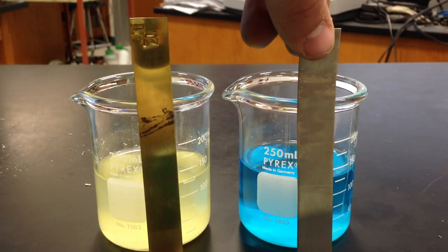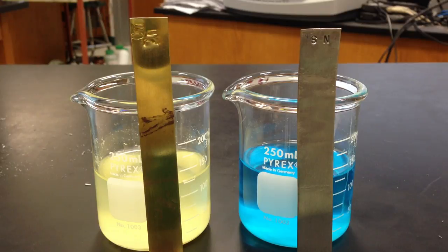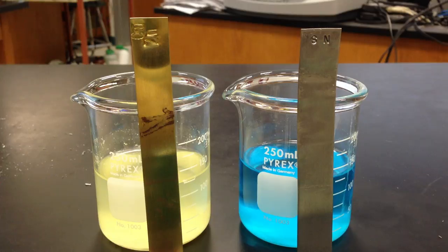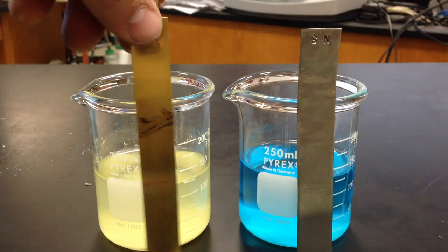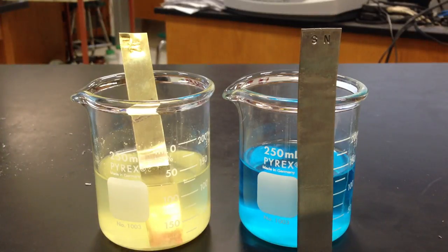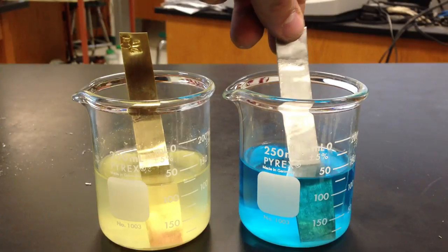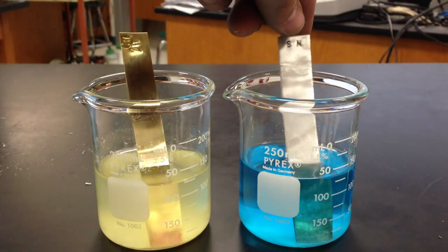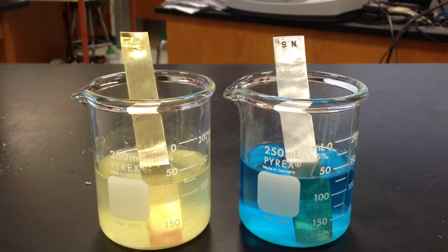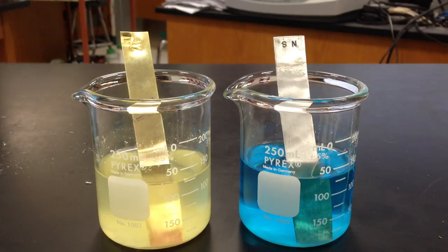Just like the half reactions we wrote in class with the net potentials, we were able to predict the spontaneity of the reaction by determining a positive or negative voltage. We drop the copper into the tin chloride and the tin into the copper chloride. One of these two creates a positive voltage, which represents a pathway for electrons to possibly flow in a redox reaction.